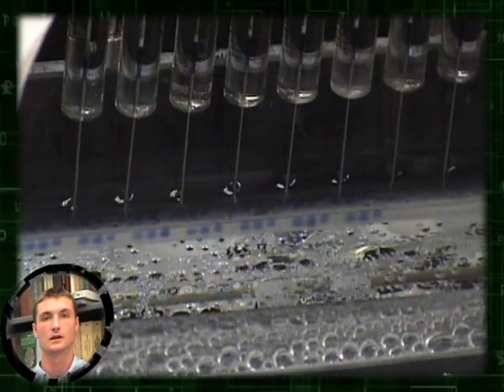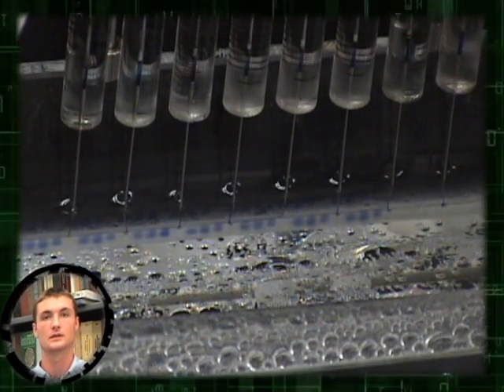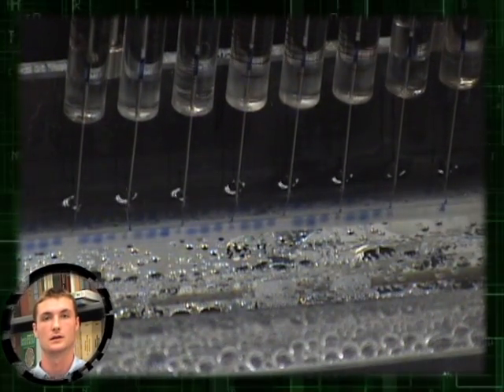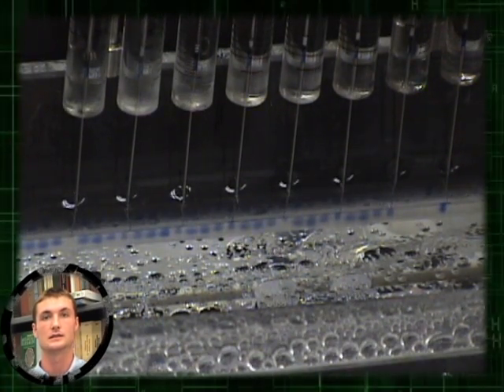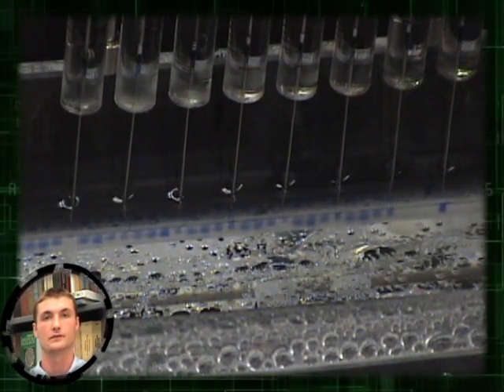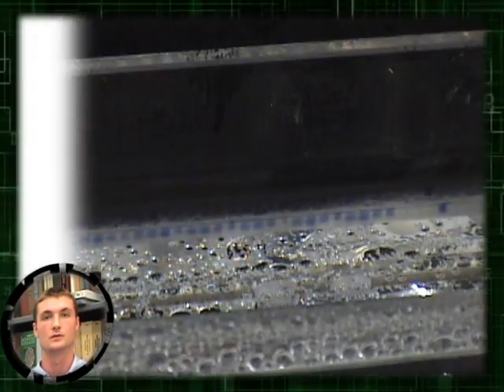Following PCR, DNA samples are mixed with dye and loaded onto a gel. The gel shown here is made of polyacrylamide, which allows us to separate DNA fragments that differ in size by as few as two nucleotides.